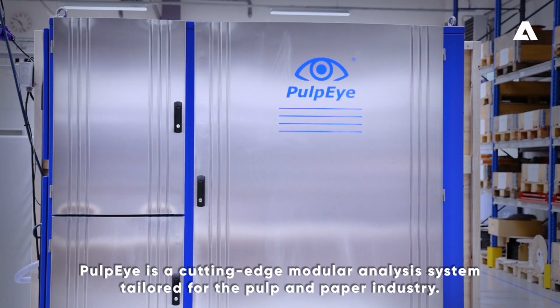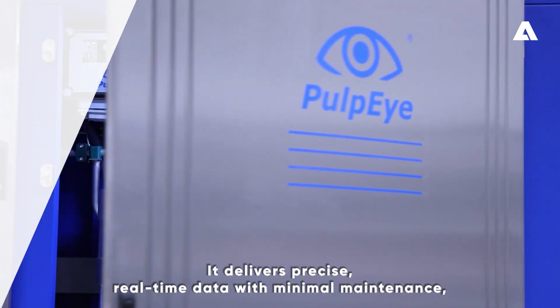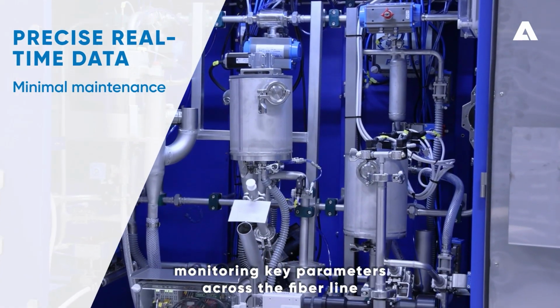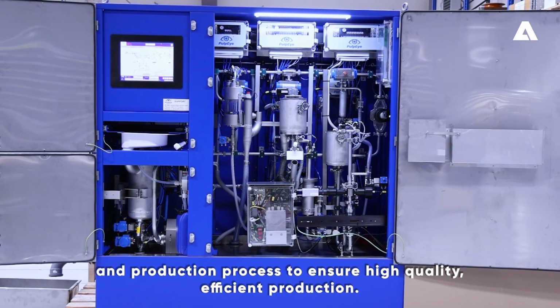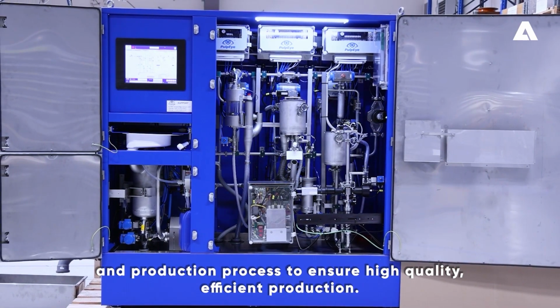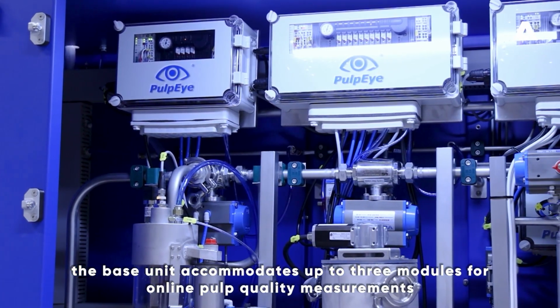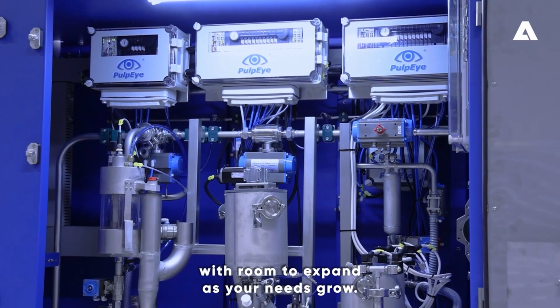PulpEye is a cutting-edge modular analysis system tailored for the pulp and paper industry. It delivers precise, real-time data with minimal maintenance, monitoring key parameters across the fiber line and production process to ensure high-quality, efficient production. Designed for flexibility, the base unit accommodates up to 3 modules for online pulp quality measurements, with room to expand as your needs grow.